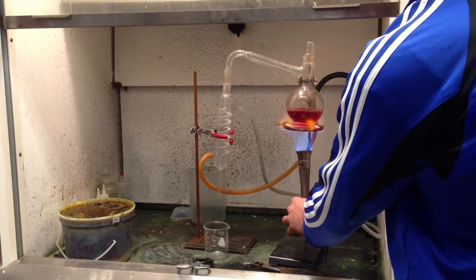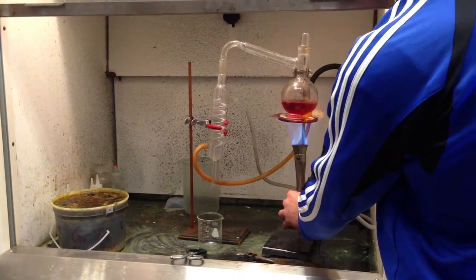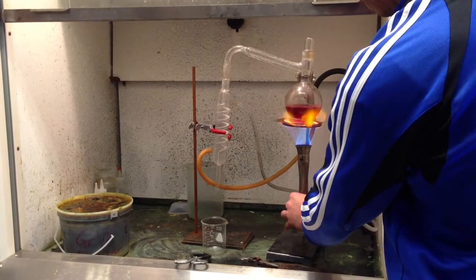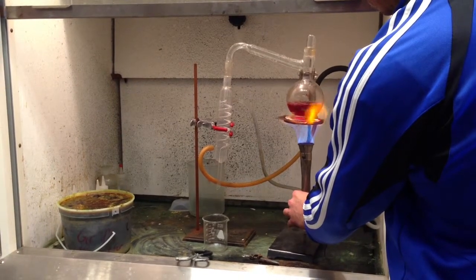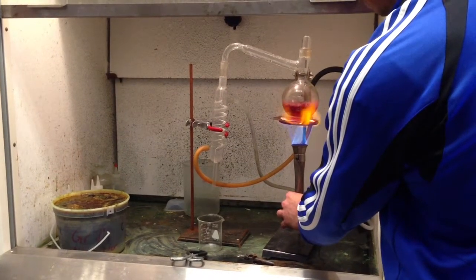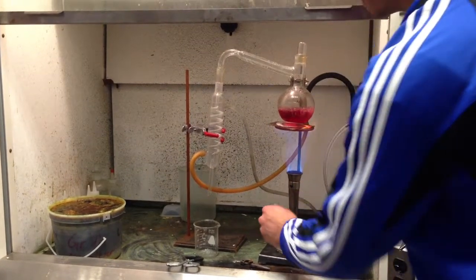We're starting to boil here. It's going to happen soon. Are you ready? Come on. There we go. Oh, here we go. Here we go. Oh, he's going down. Zoom. It's like the zoom from at Atlantis there.